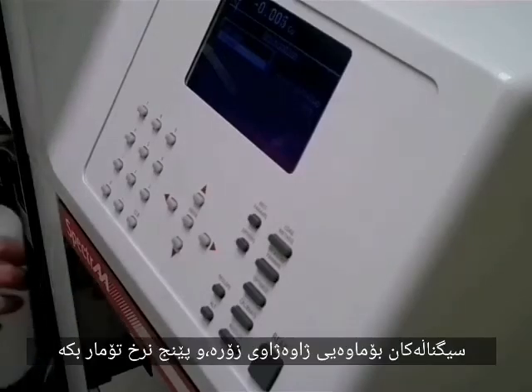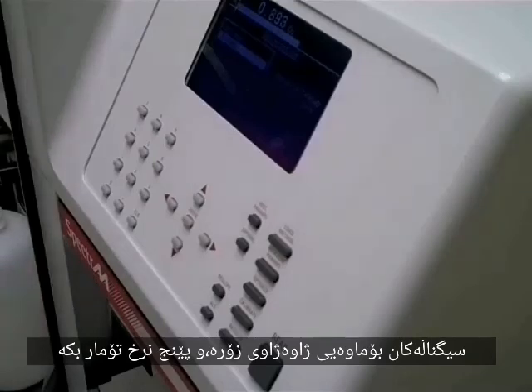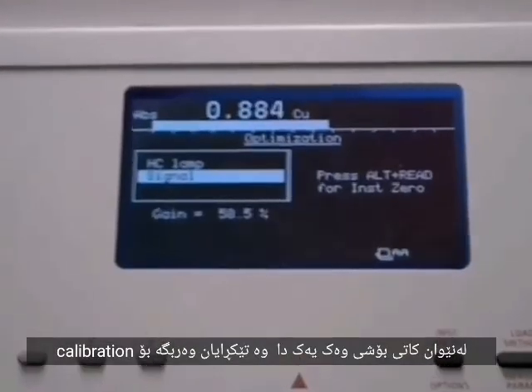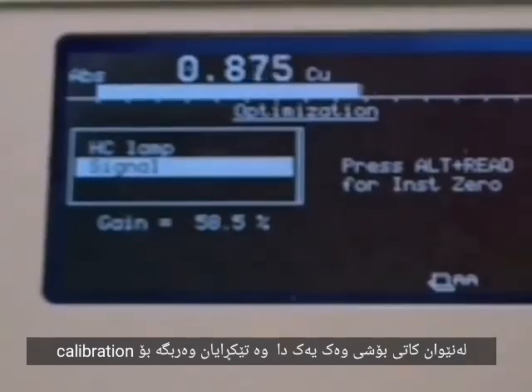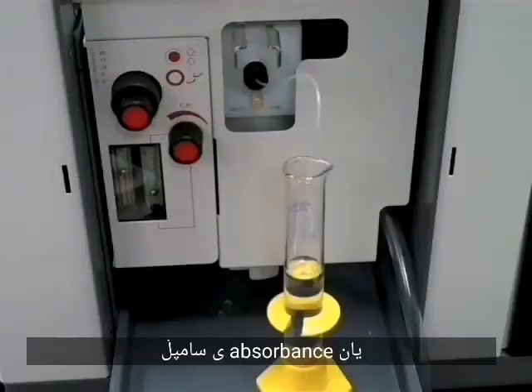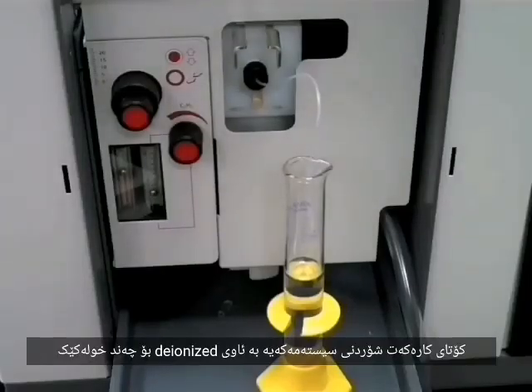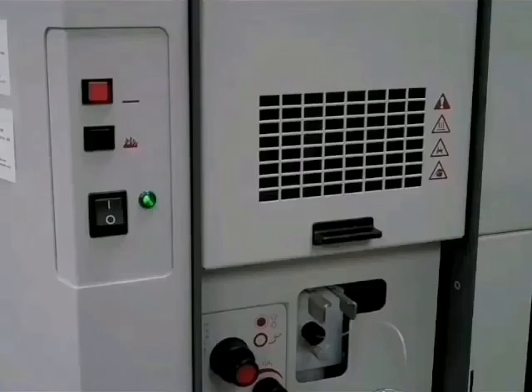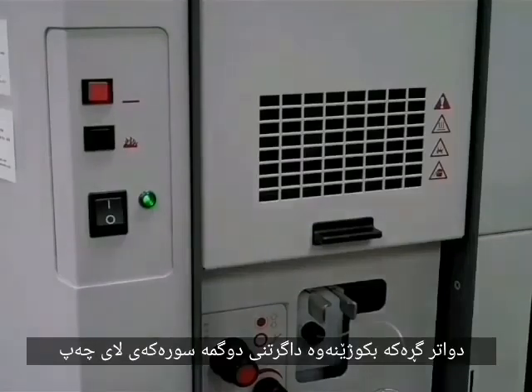The signal is inherently noisy. Record 5 readings at evenly spaced time intervals and use the average for your calibration point or sample absorbance. At the end of your work, rinse deionized water through the system for several minutes. Then turn the flame off by pressing the red button on the front left.